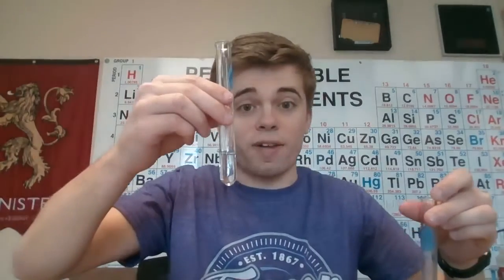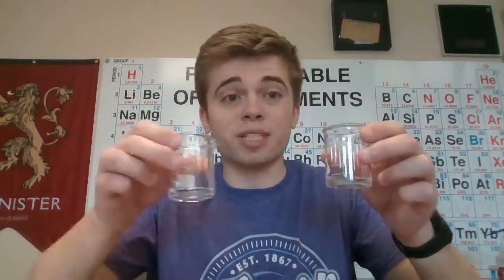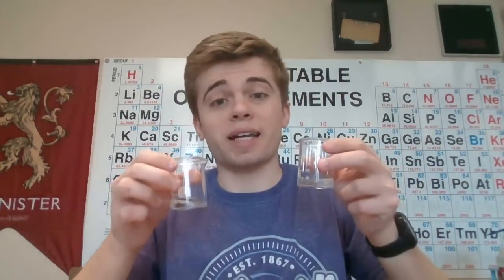So if I look here, we are pretty much ready. I have my 5 degrees Celsius ones here. I measured out 5 milliliters of solution A and I'm going to pour that into my test tube, then 5 milliliters of solution B. Now we're going to mix them, and just like in the last part, I want you to time how long it takes.